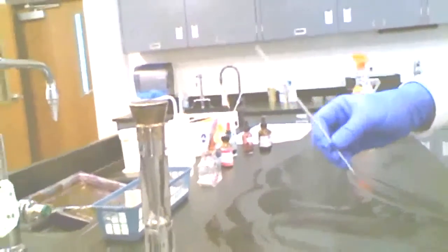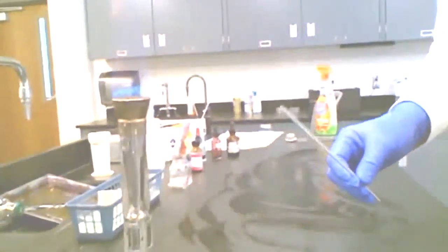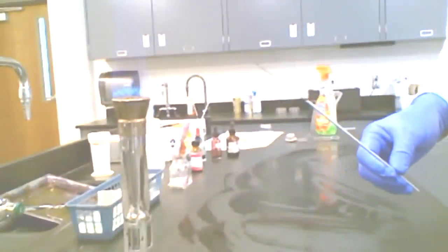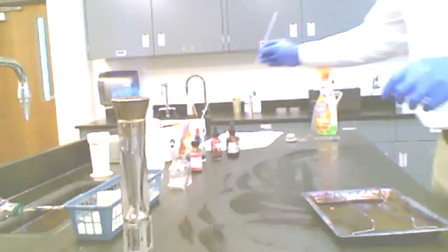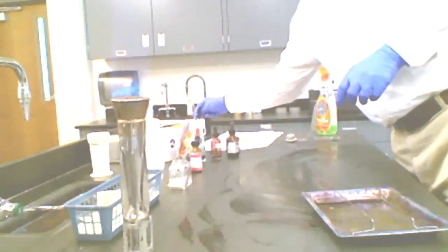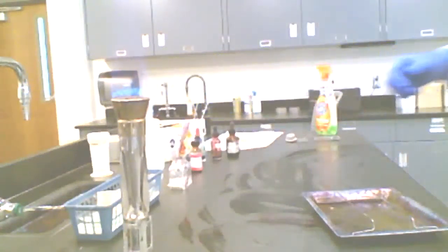Now, this is sterile. I've actually sterilized this. There are no living things on there at present. It'll take a while for this to cool off ultimately. Well, it could accumulate some things, but for now it's sterile. All right, and I'll have to sterilize this again. I'm going to set that aside. Let me show you what I'm going to do with my slide and my organism.